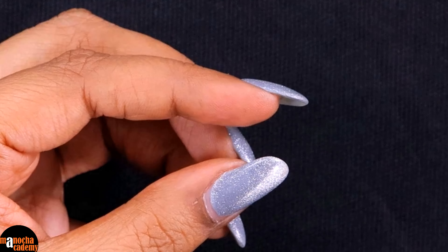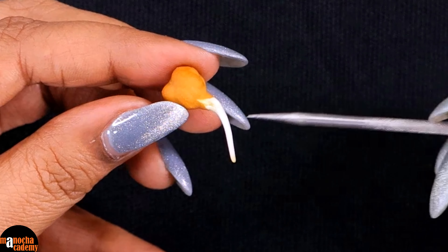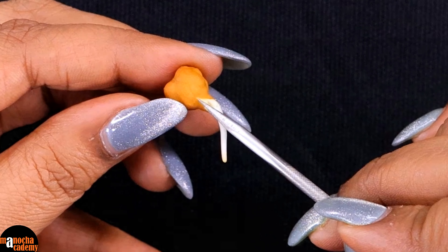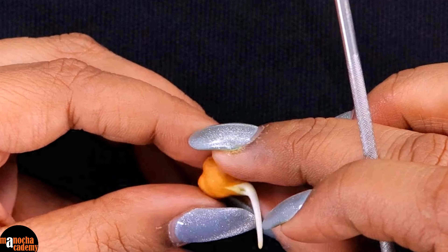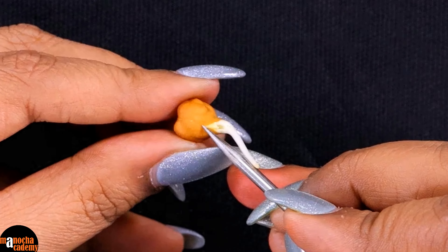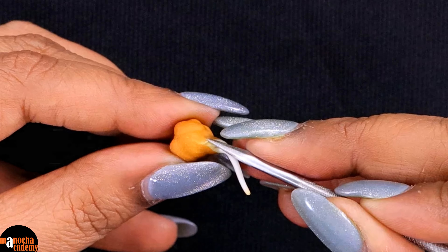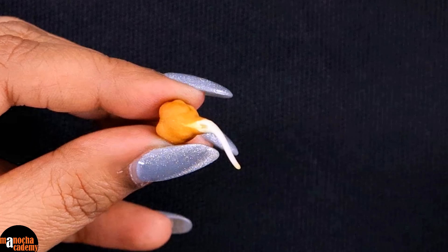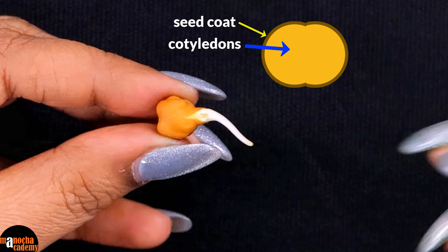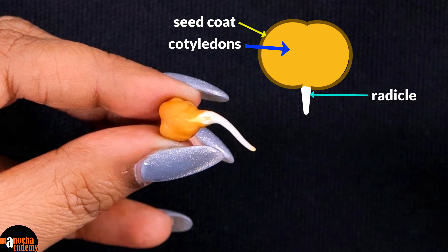I am taking a seed which has already germinated. When the radicle comes out, the testa already starts bursting, because the seed has been kept in water for some time so that it starts germinating. Keeping it in water makes the seed absorb that water by imbibition and swell up. When the cotyledons swell up, the seed increases in size and the pressure breaks the seed coat.